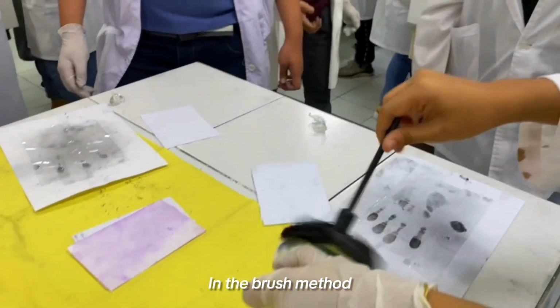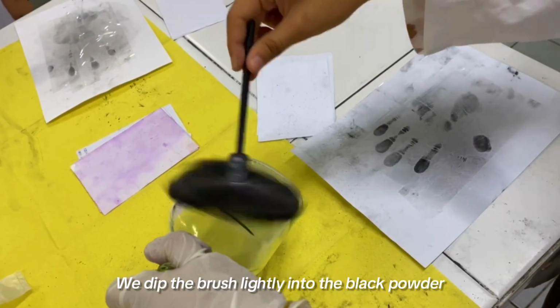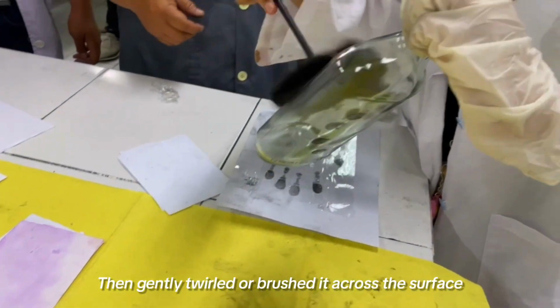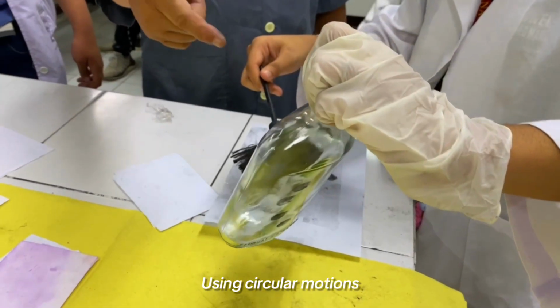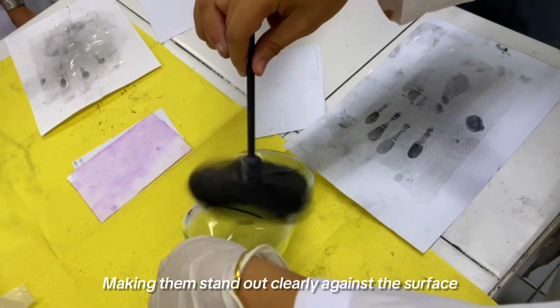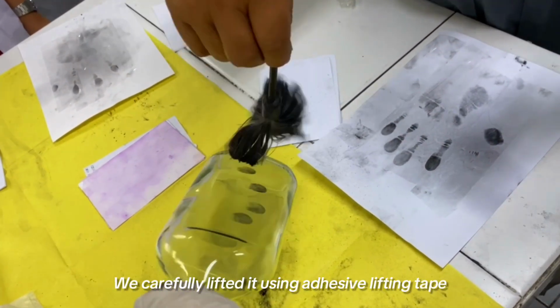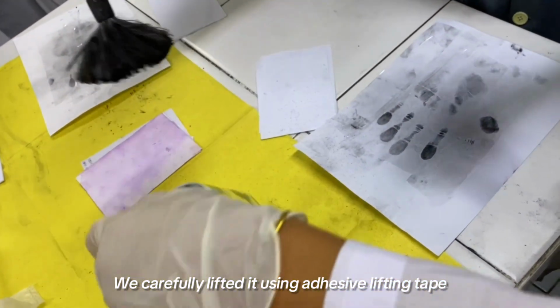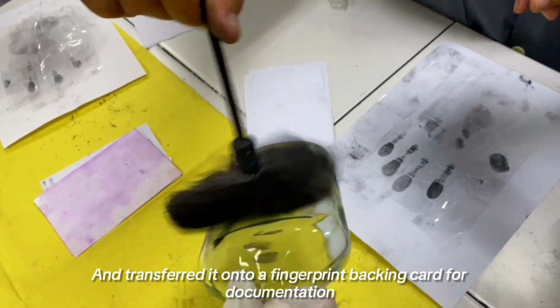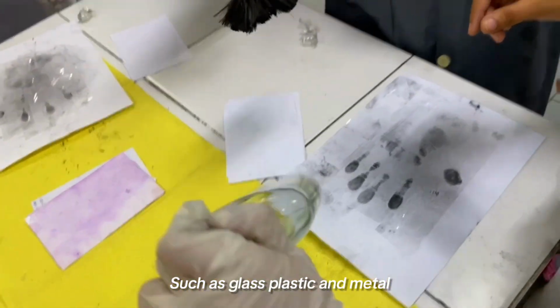In the brush method, we used a soft fiberglass or camel hair brush. We dipped the brush lightly into the black powder, then gently twirled or brushed it across the surface using circular motions. The fine powder clung to the fingerprint ridges, making them stand out clearly against the surface. Once the print was developed, we carefully lifted it using adhesive lifting tape and transferred it onto a fingerprint backing card for documentation. This method worked best on non-porous surfaces such as glass, plastic, and metal.